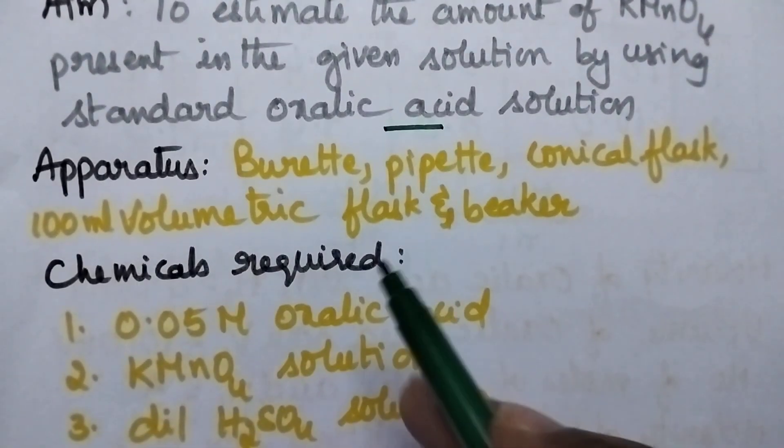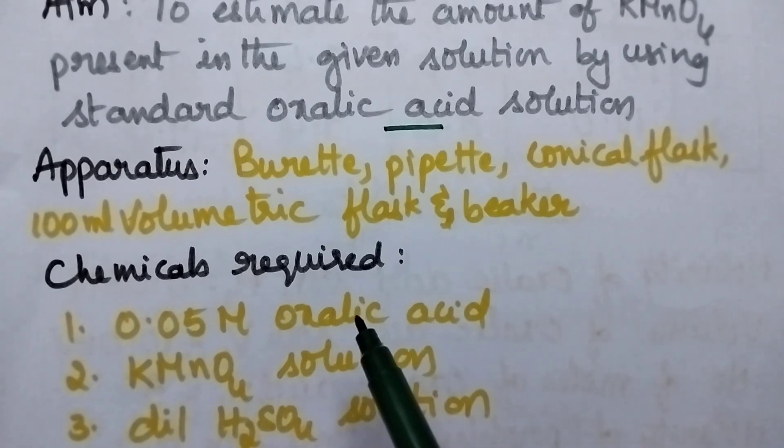Apparatus involved are burette, pipette, conical flask, 100 ml volumetric flask and beaker.